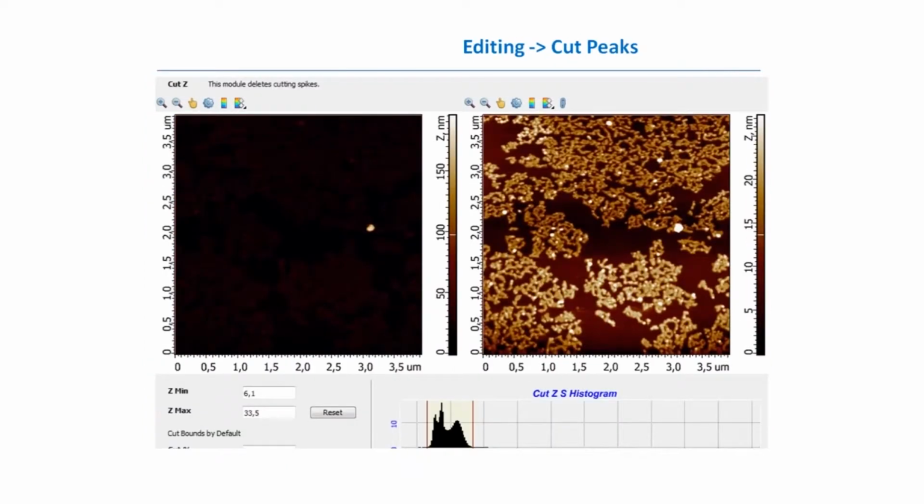Another method is called cut peaks, because sometimes in plane everything's wonderful, but some big features, like in this example, take most of the color from the color palette, and so you see the dark background with some bright particle, which doesn't have any scientific meaning. In this case, we can just cut pixels which lie out of the area of our interest, to cut the heights we are not interested in. And by cutting these pixels, we just cut this data from the image.